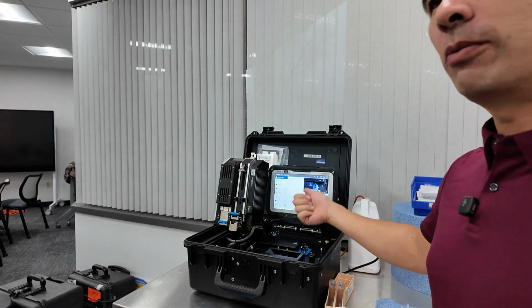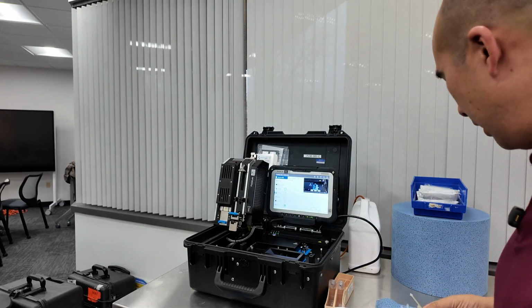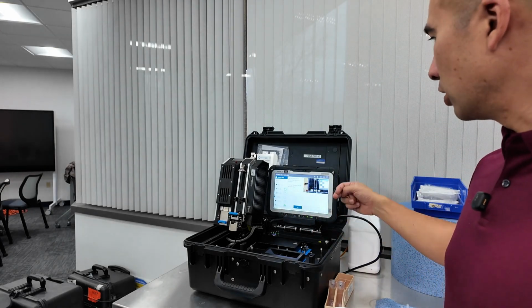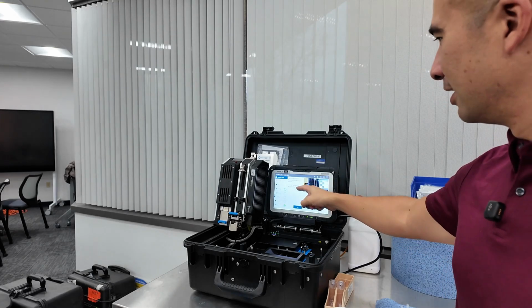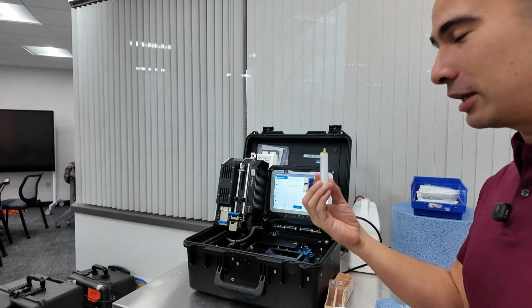So can we go back into the 0 filtergram just to check that it's complete? It'll tell you when you go to particles. If it wasn't completed, it would tell you. Oh, okay. All right, so next step is to go into particles. So take filtergram from elements, place it in the particles, insert syringe with sample. So the syringe in this case is something like this.